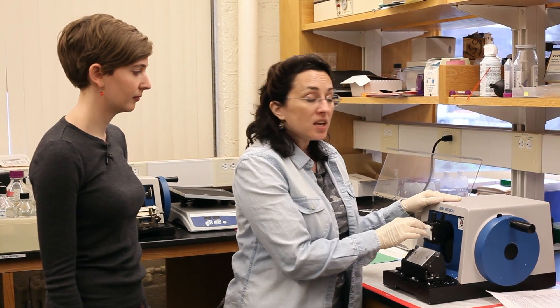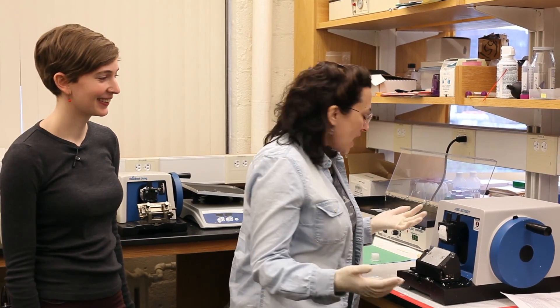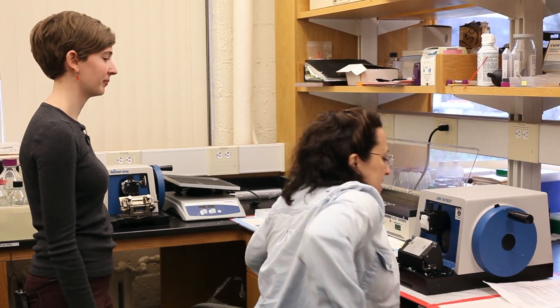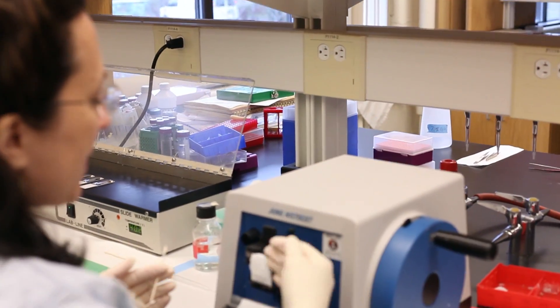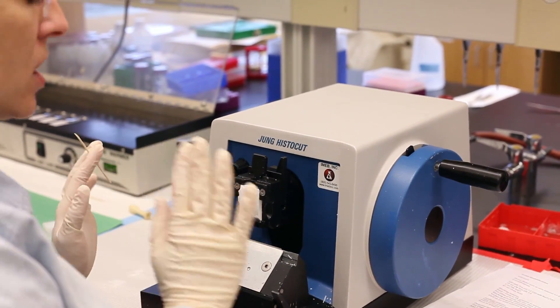Now we're ready to start the experiment. We have already collected really early flower buds, chemically preserved them, infiltrated them with wax, and put the plant material and wax into a little plastic mold. That allows us to put the tissue onto this machine called a microtome — it's like the deli slicer of science. It allows us to make really, really thin 8-micron sections of this plant tissue. I'm going to sit down at the microtome and rotate this wheel, which will move the wax past a really sharp blade — don't touch the blade.